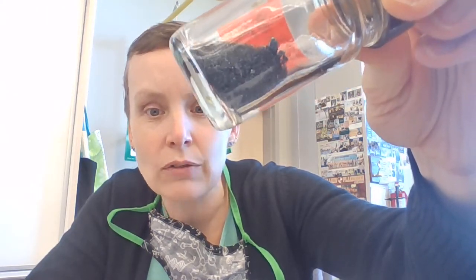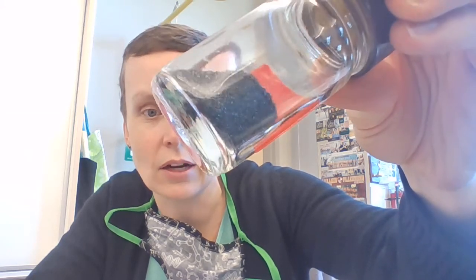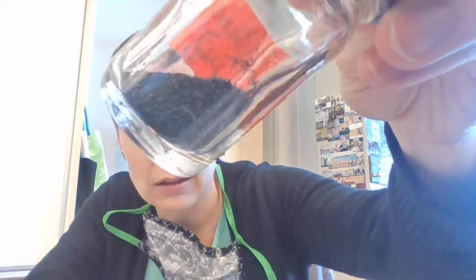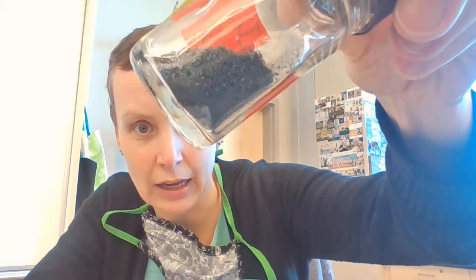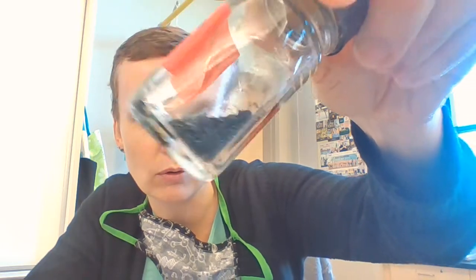Now, most of you have probably experienced iodine in a liquid form where it's dissolved into either water or an alcohol water mix in your medicine cabinet. And it doesn't look anything like this in there. So this is kind of a glittery, dark blue or black solid. Okay. The color's not really showing up here, so you probably are seeing black, but it does have some definite blue hue to it if you are in person.